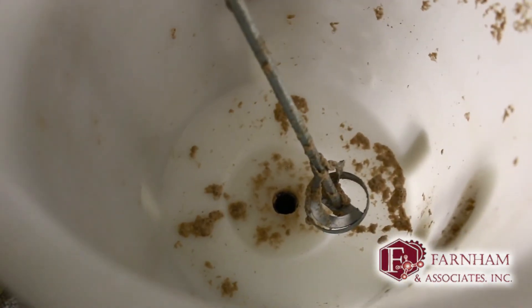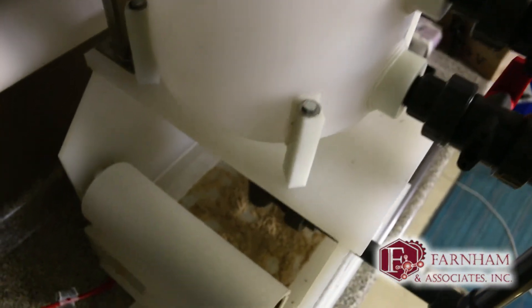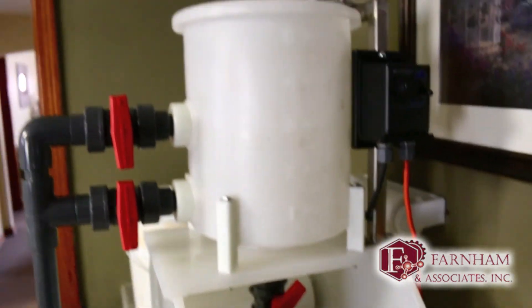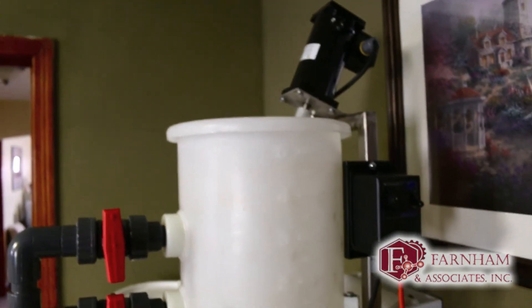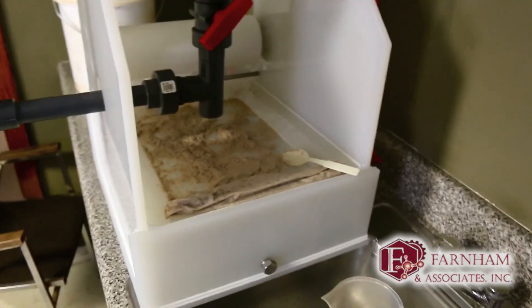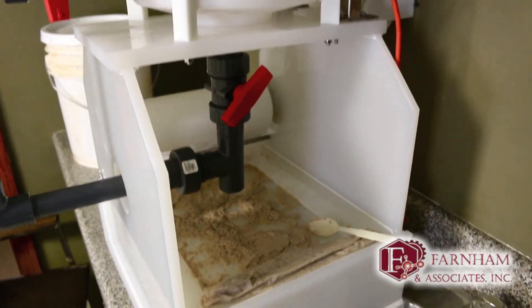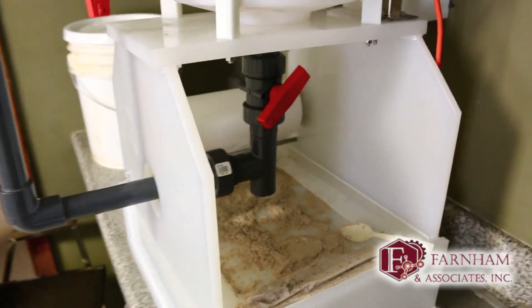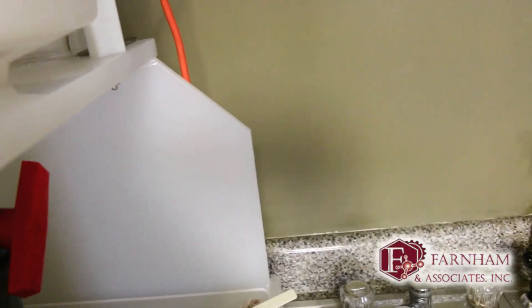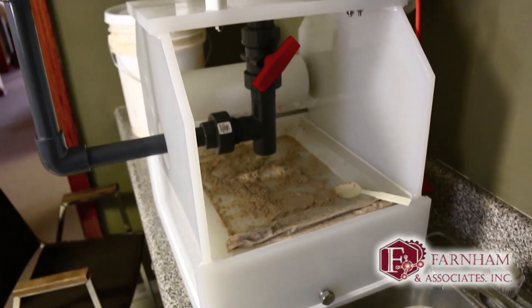The tank doesn't look too bad and the continuous flow of water through there should take care of that. But that's it — that's the gist of the deep bed paper filter. This was designed by Leon Kuznik and the product we used was Wild Bend — I think it was 2055, just a bentonite clay product.